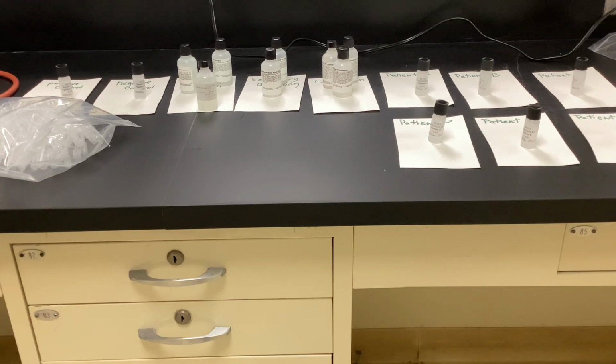So when we're all done, some of the wells should be dark purple. I know it's an antigen-antibody reaction. I know that patient literally has Lyme's disease. If it's light purple, they may have Lyme's disease. It might be an early infection or it might be a late infection. We'll see what the scenario is.